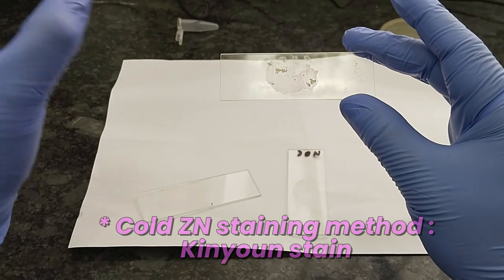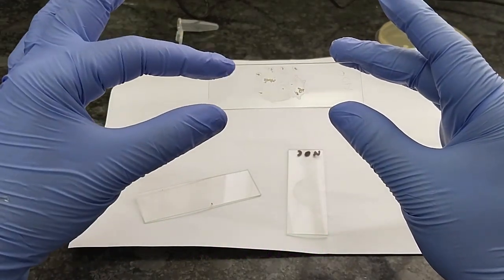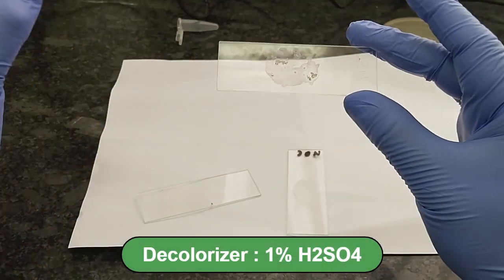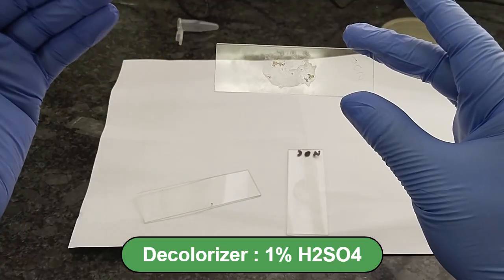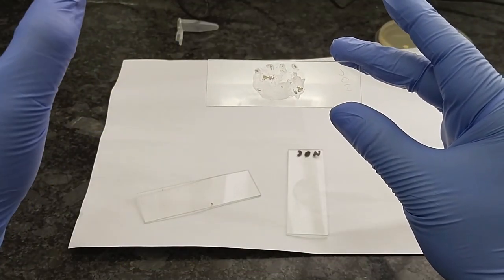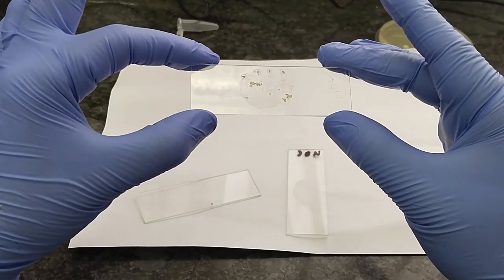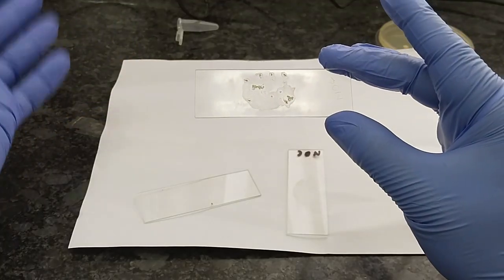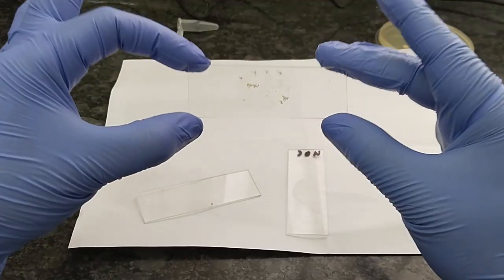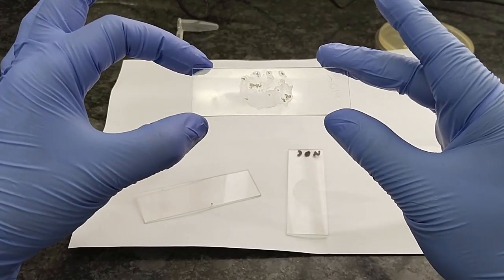Then pour off the stain and wash the slide. After washing, decolorize it using 1% H2SO4. After the 1% H2SO4 decolorization process, add the contrast stain methylene blue, keep it for 1 minute, and wash the slide with tap water. Finally, focus the slide under the microscope at 100x power.